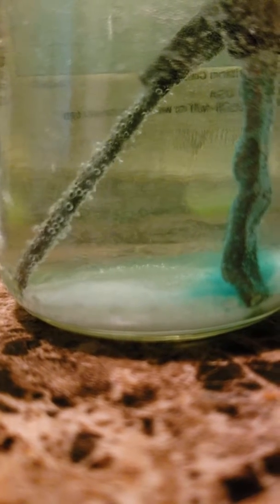I'm making copper chloride 2 using vinegar, water, salt, and Clorox. And it's actually working. See, it's making blue crystals come out of the copper.